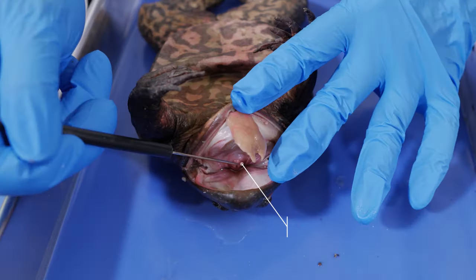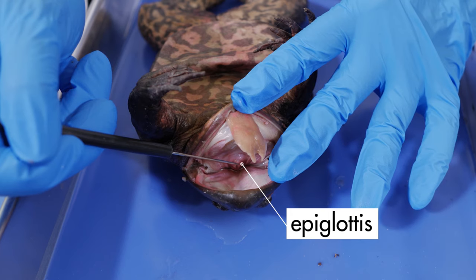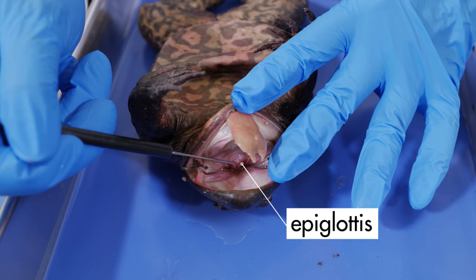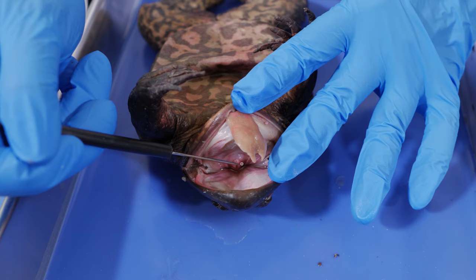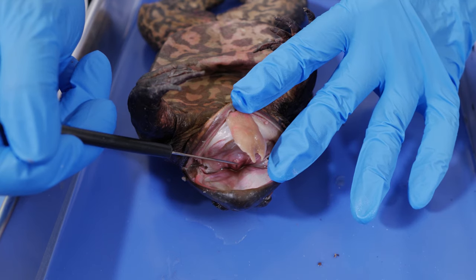This flap is called the epiglottis. When the frog swallows food, the epiglottis closes the trachea to keep food from entering the lungs.